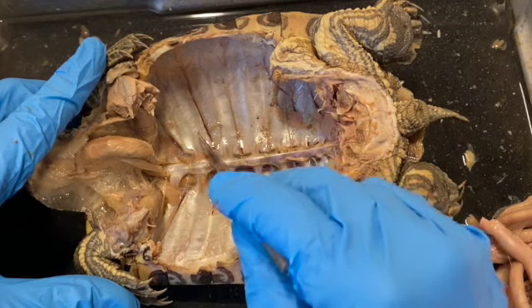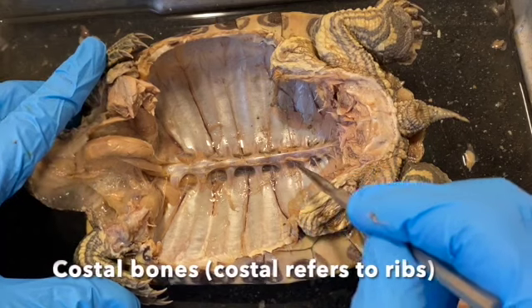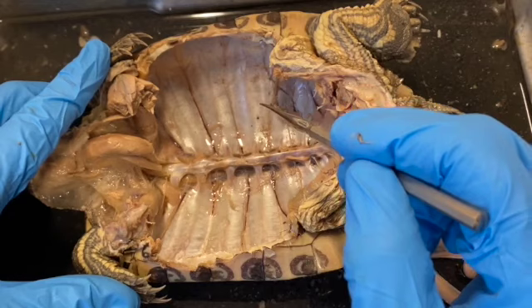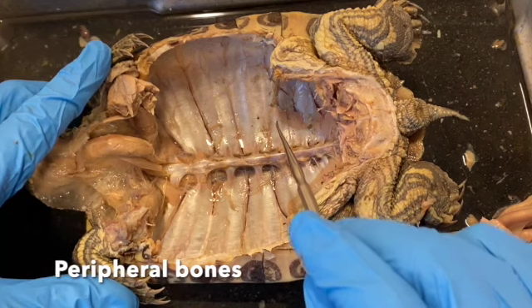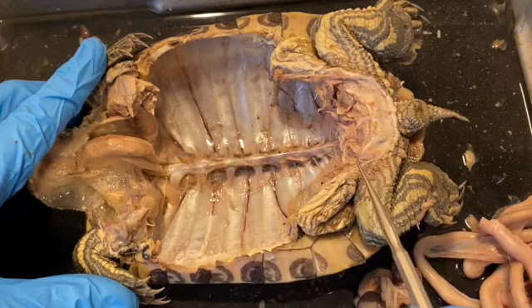And these bones out here on the sides, these are the costal bones, and they extend all the way out to the edge, well, near the edge, and then underlying the marginal scutes are marginal bones called the peripheral bones, and they're also numbered anterior to posterior.